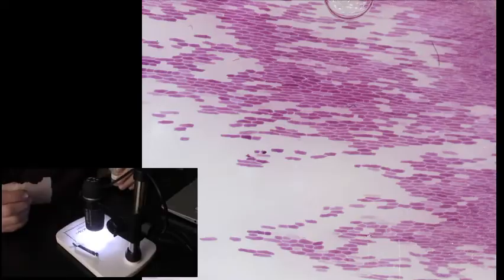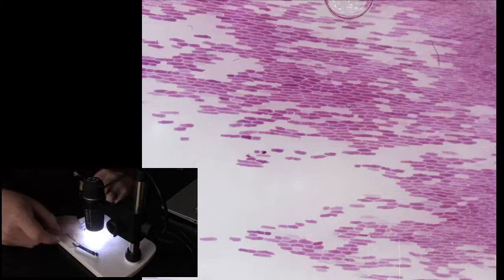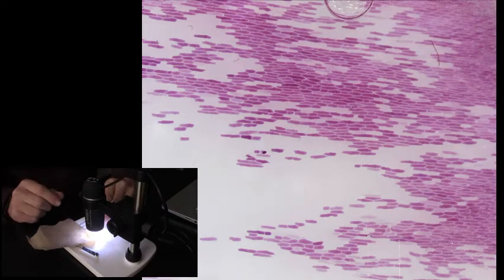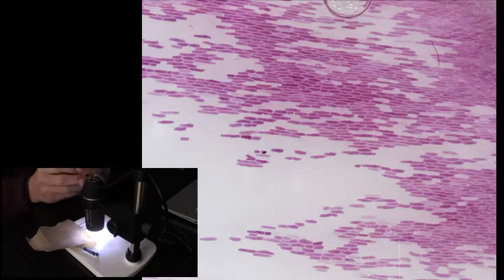Please remember that that salt water is about 90% water, 10% salt. So much lower concentration of water than that of the cytoplasm that is making up those red onion cells. So check those out.